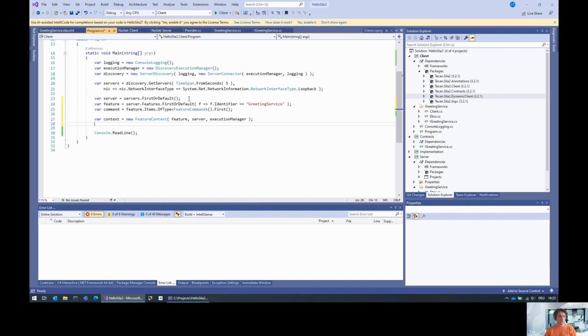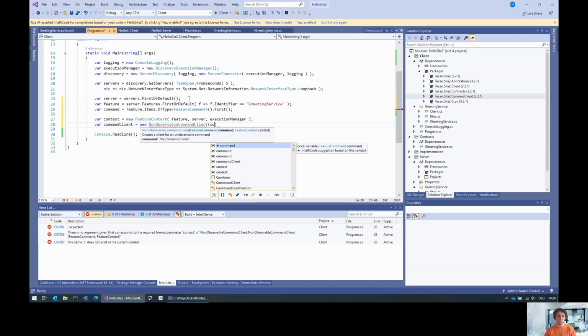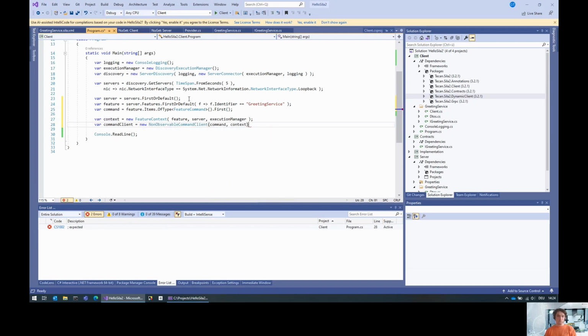Next, we create a command client. That is a new non-observable command client for this command and this context. Here we actually know that this is a non-observable command client. The command client for an observable command is a bit different, but you can actually query whether a command is observable or not by just investigating this object here.